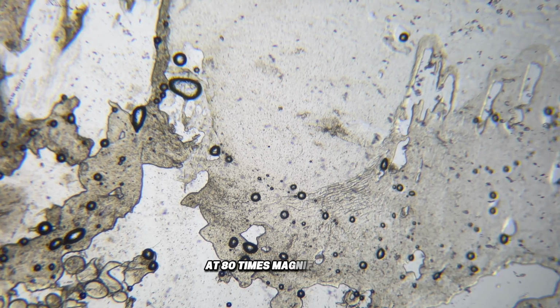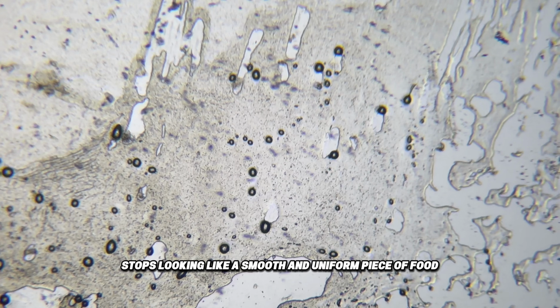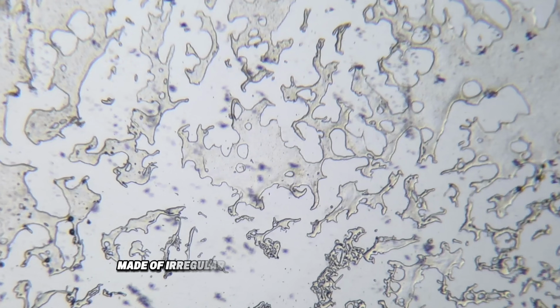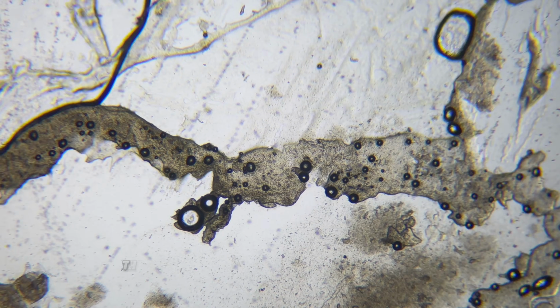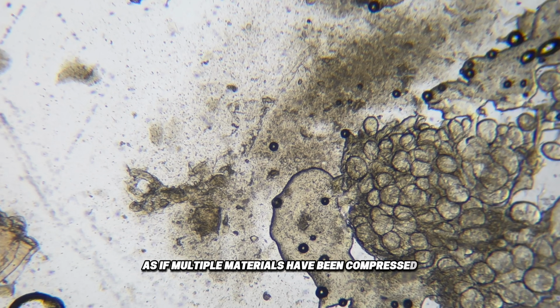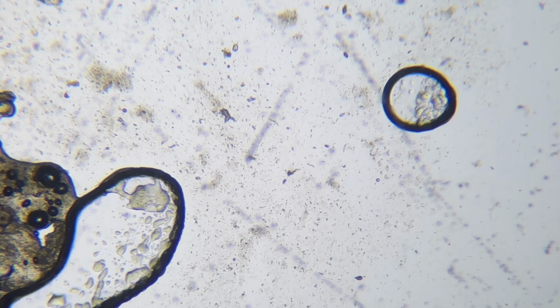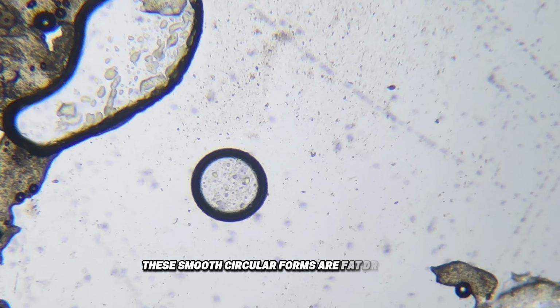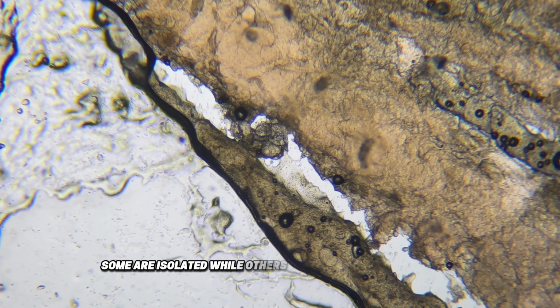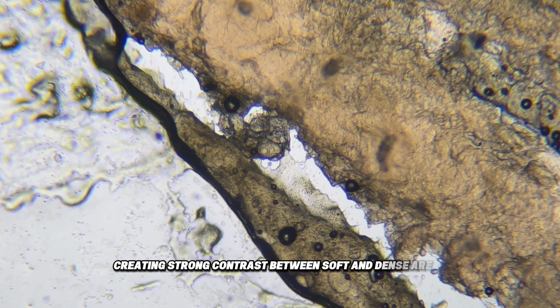At 80 times magnification, the sausage immediately stops looking like a smooth and uniform piece of food. Instead, the surface reveals a dense and uneven landscape made of irregular fragments pressed tightly together. The structure appears chaotic, with no clear pattern, as if multiple materials have been compressed into a single mass. Large rounded shapes begin to stand out across the field. These smooth circular forms are fat droplets, scattered unevenly throughout the sample. Some are isolated, while others cluster near darker regions, creating strong contrast between soft and dense areas.